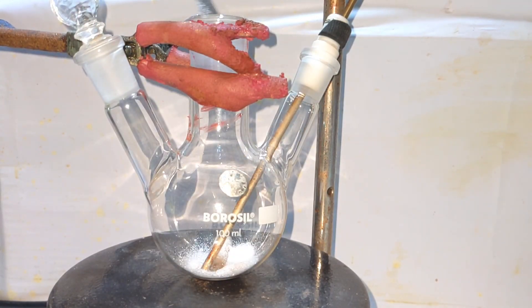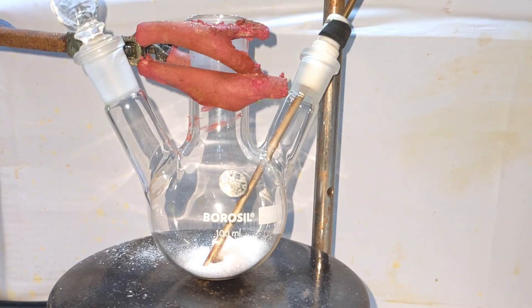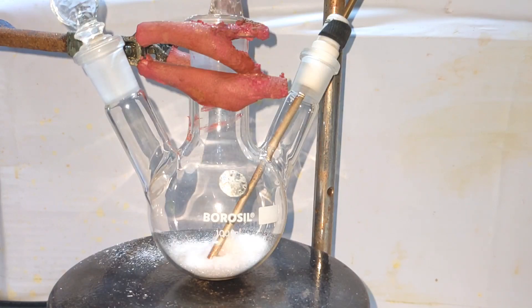A magnetic stirring bar is also placed inside the flask. 5 grams of hydroquinone is then slowly added to the flask with a spatula trying to avoid spillage, but as usual I spill the compound. Hydroquinone is a white fluffy powder.